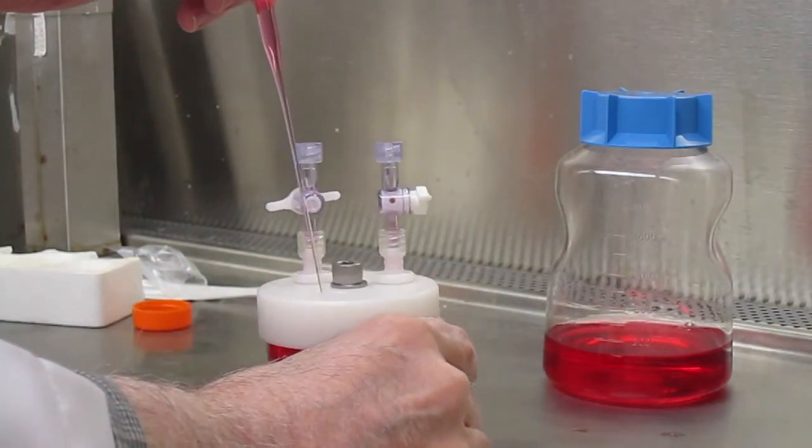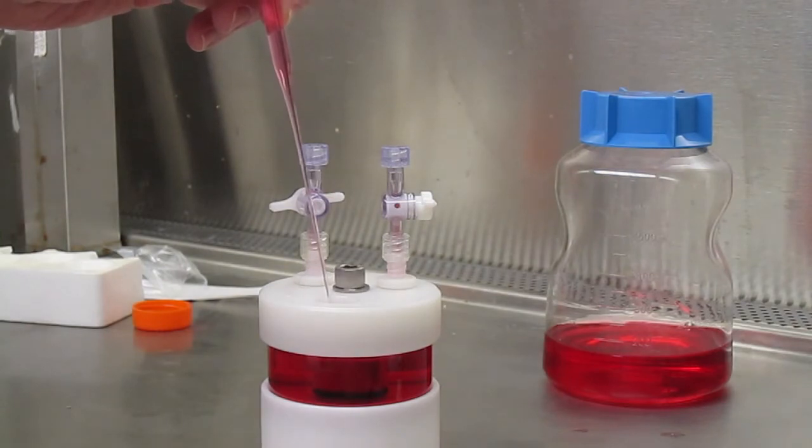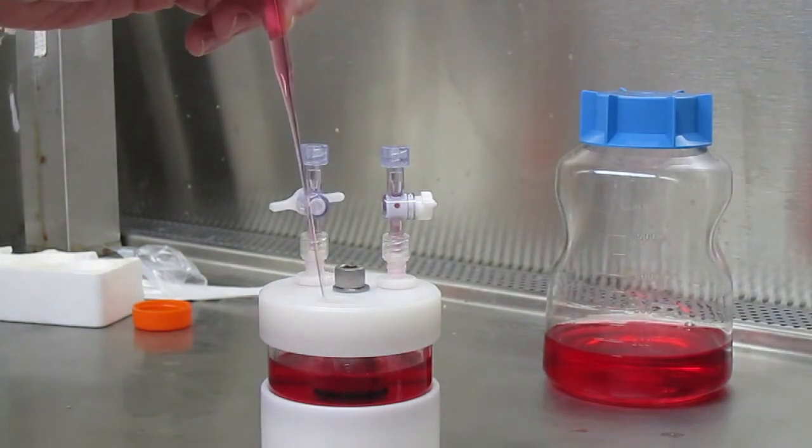Approximately three quarters of the media should be removed so as not to inadvertently take cells out of the vessel.